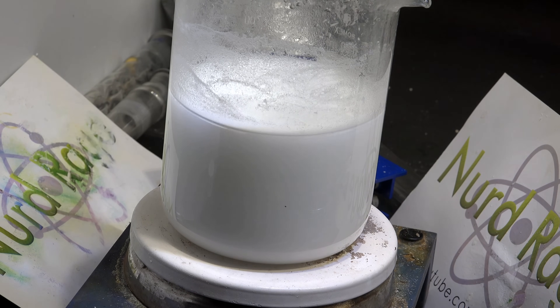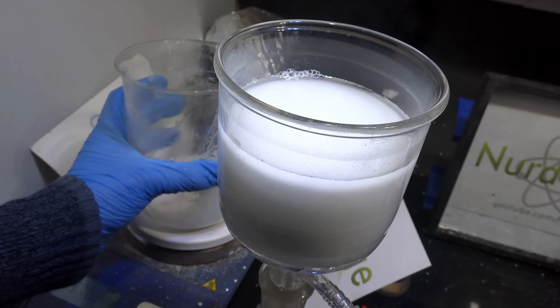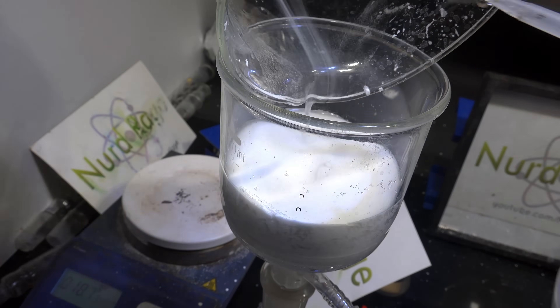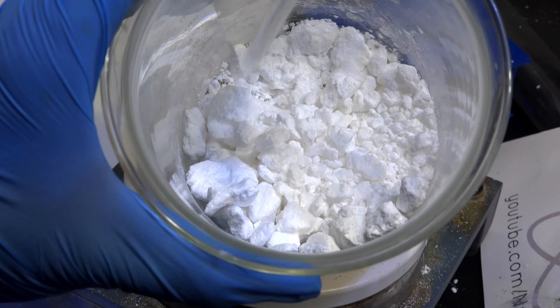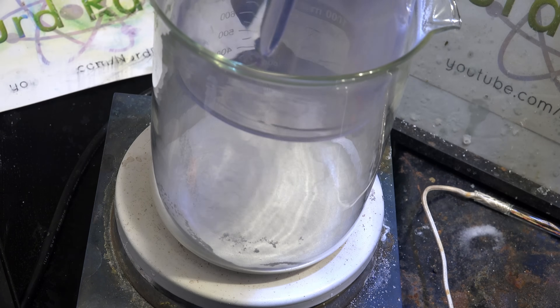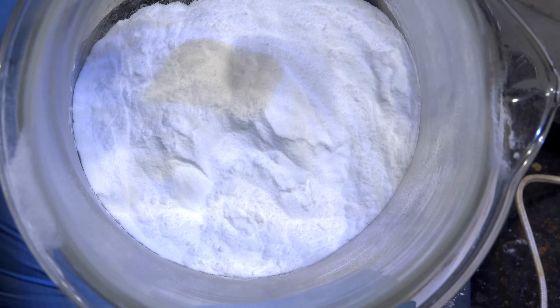Sodium oxalate, on the other hand, is easy to make and purify. Drying it is also easy and it doesn't have water of crystallization to throw off weight measurements, so overall it's a better analytical standard than oxalic acid. Once all the sodium hydroxide is added, turn off the heating and let the mixture cool back down to room temperature. Keep stirring it though, as you don't want aggregation. When it's cool, vacuum filter the mixture. Wash down the product with water to remove any remaining impurities. Scoop it out and heat it in an oven or on a hot plate at 200°C. Here it is after heated drying. Grind it up into a powder by hand or using a blender, then heat it again to 200°C for about an hour to drive off all remaining water. For analytical use it's important that it's dry. And there we have it — sodium oxalate.